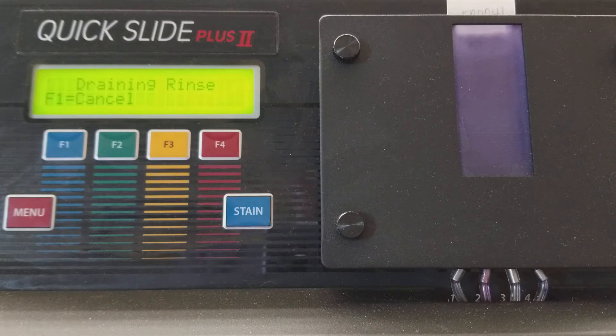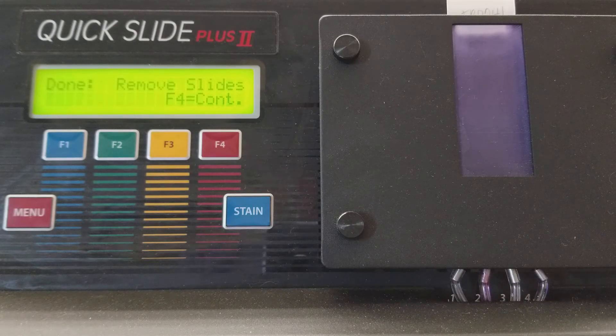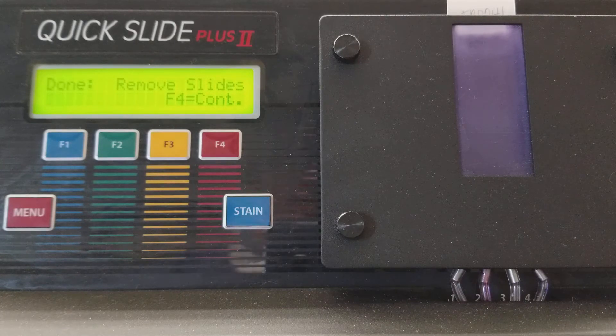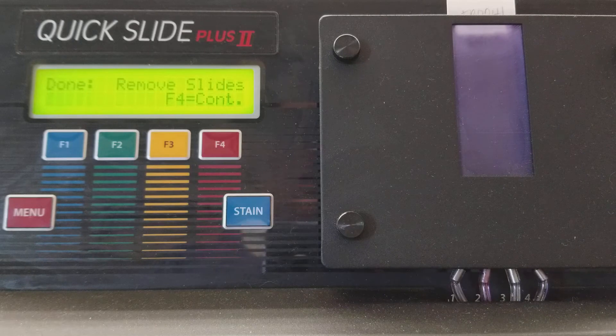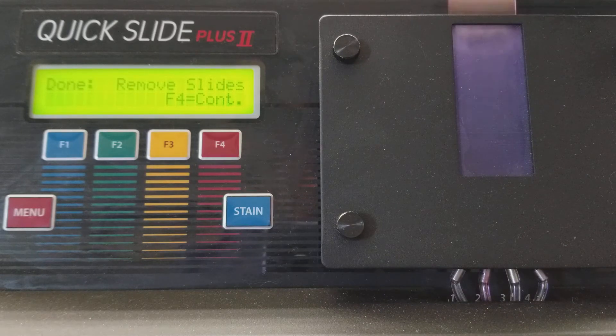During any time that you might need to cancel this process, you just press F1. This is the end now. I did not cancel it.